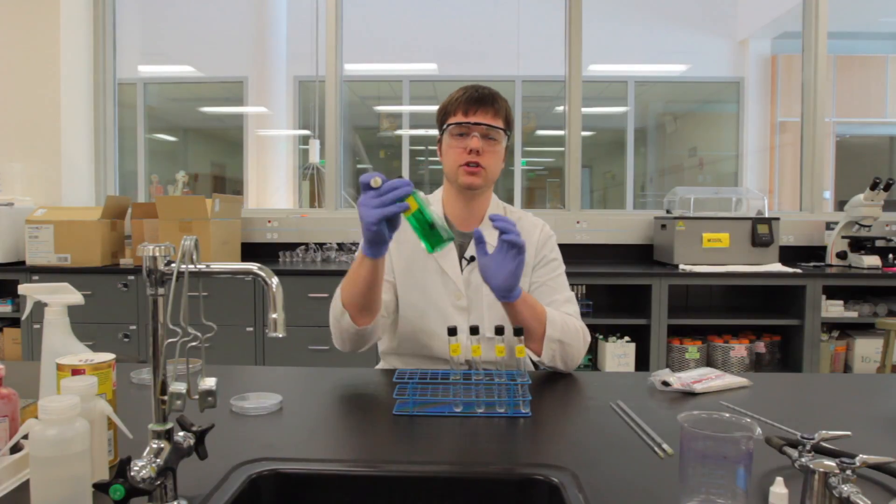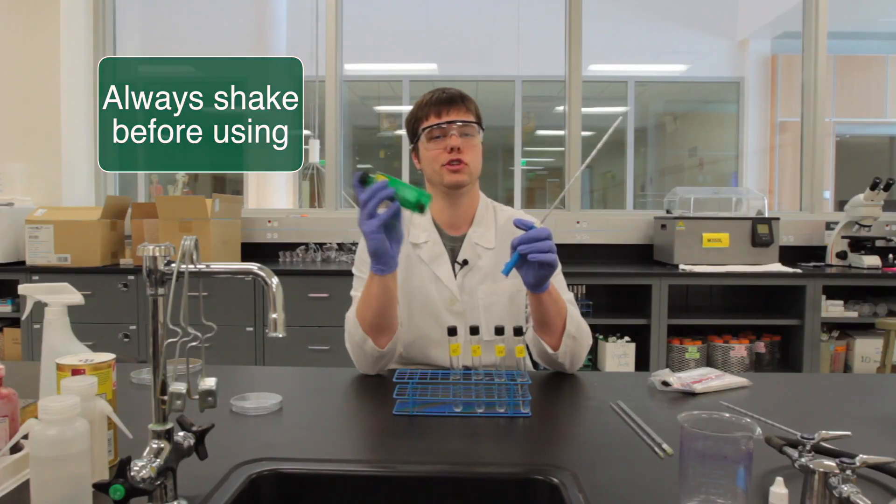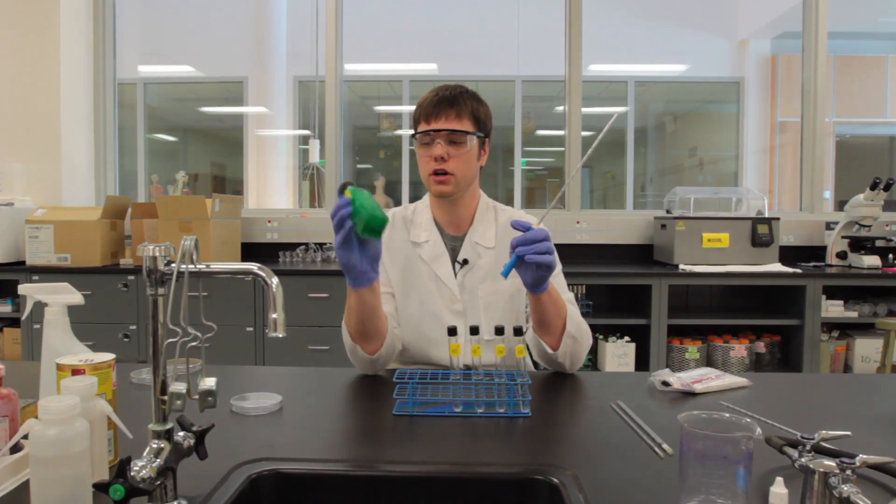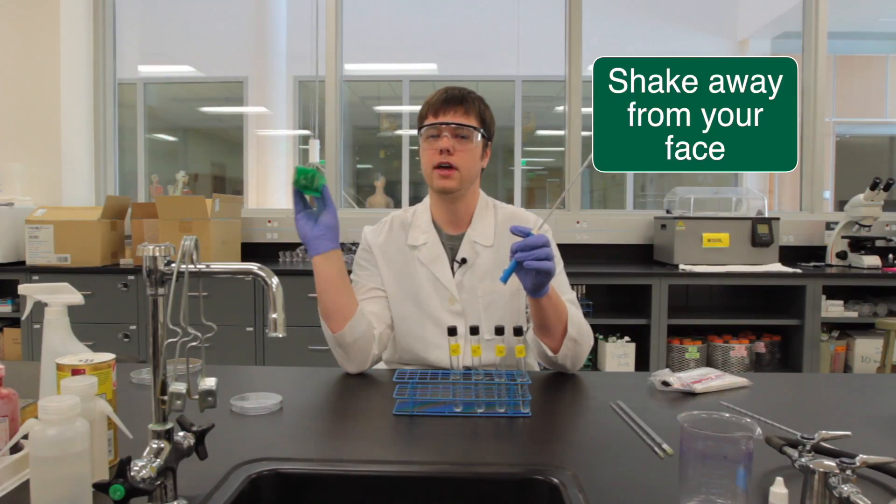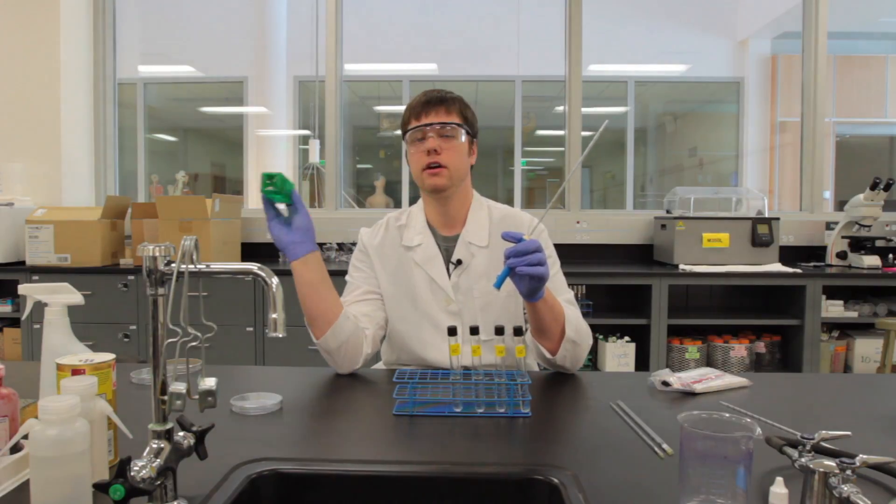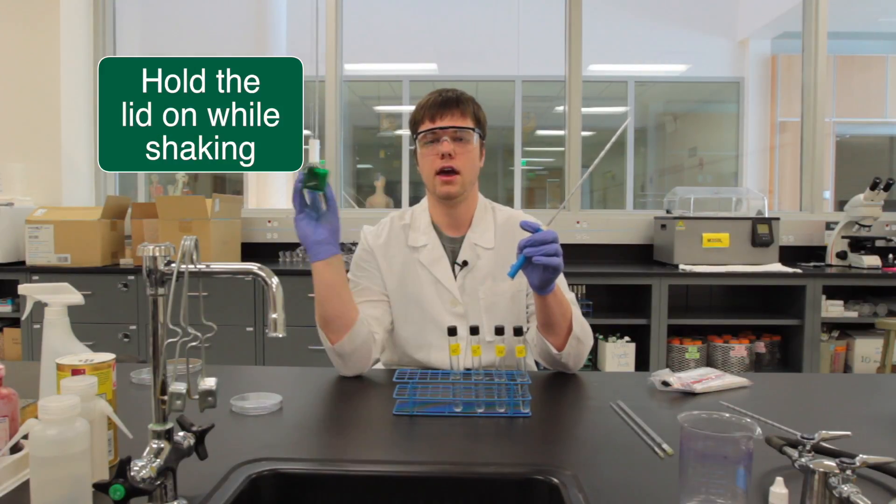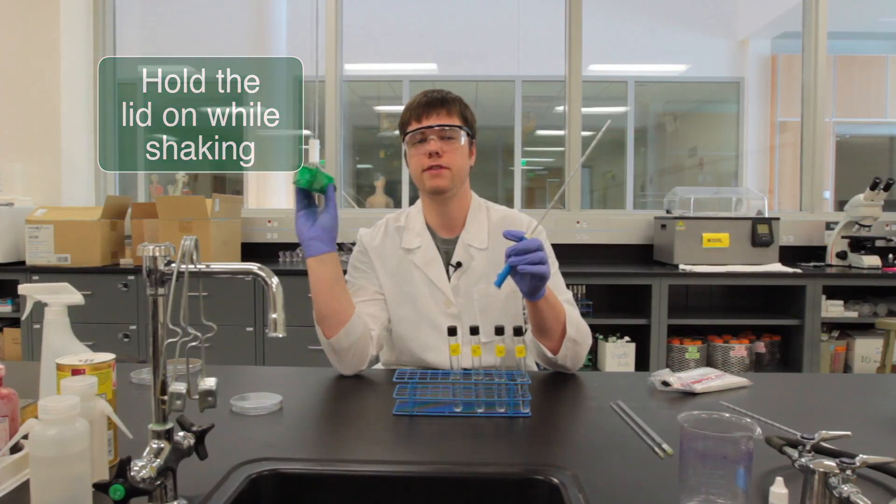We've got our stock solution. We want to make sure we shake that up nice and well. Be careful sometimes the lids don't stay on real tight. You want to make sure you shake away from your face. We don't want any potential bacteria getting near your face. We've got our finger on the lid as we're shaking. Give it a nice about twenty-five shakes, that's enough.